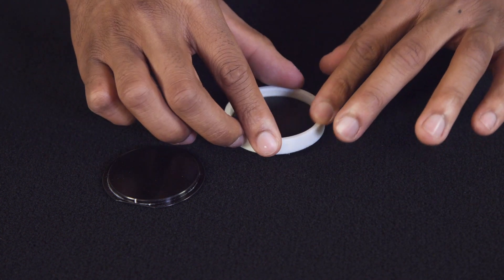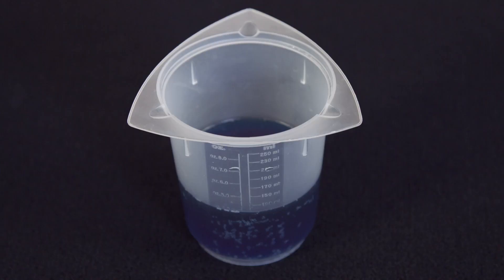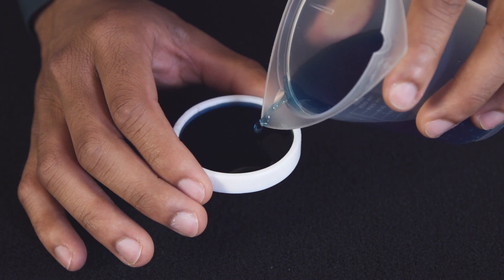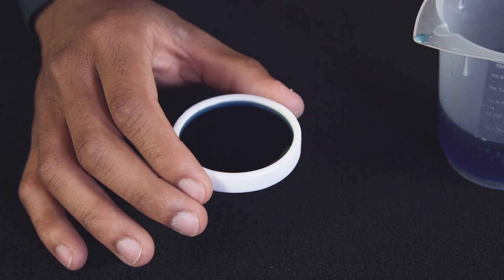At this point, you can now fill the ring with your sample liquid. The amount of liquid used to fill the cell will be dependent upon the ceramic ring's height. Here, we want to overfill the cell, meaning we fill it up to the very top, almost to the point of running over.